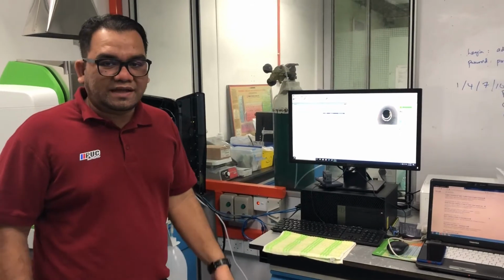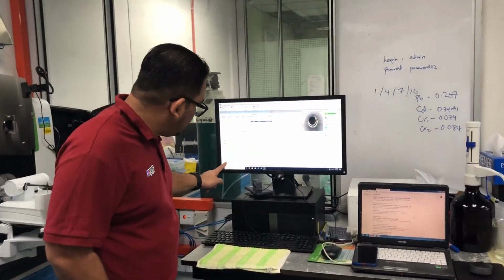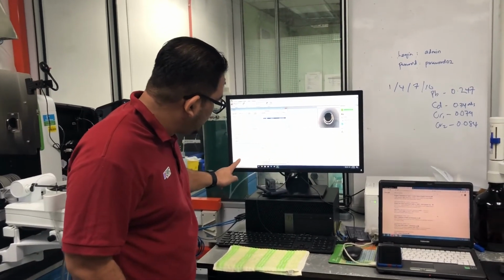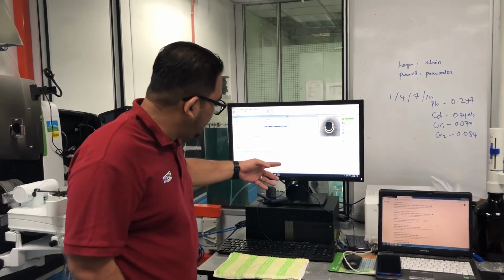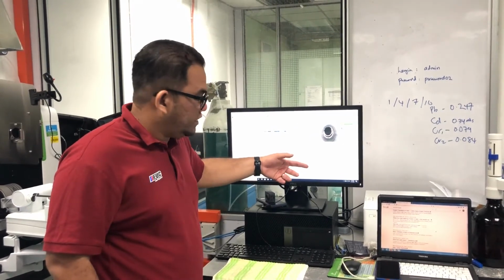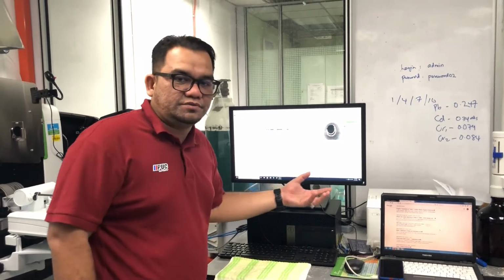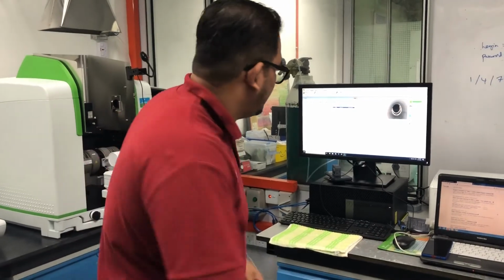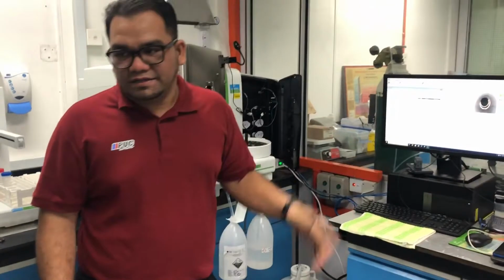We are not calibrating the instrument yet, so we don't know the exact concentration. Actually, we can, after we calibrate; the calibration plot is displayed here, okay? And then we will directly know the concentration, because the instrument will refer to the calibration curve. If it reads this amount of absorption, what is the concentration? Remember, we must teach the instrument. Alright, so that is AAS.